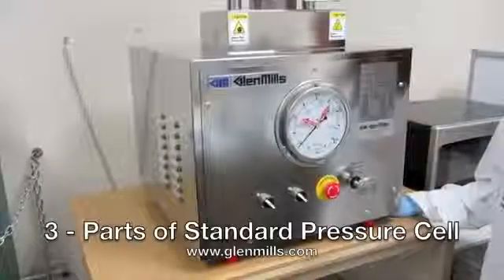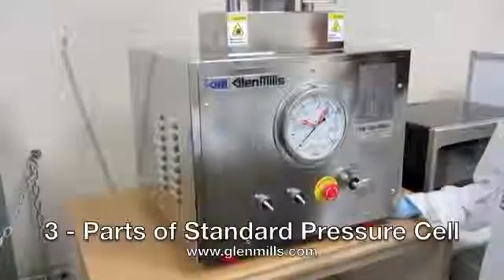The standard pressure cell, when loaded with cells for lysing, will be inserted into the French Press GM.